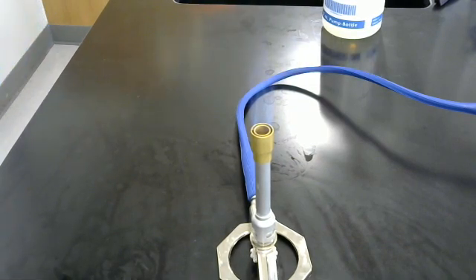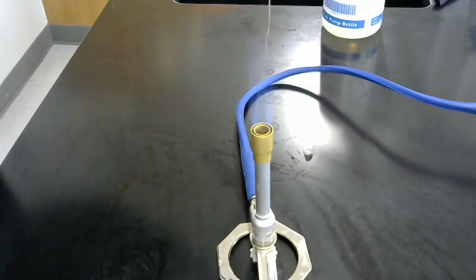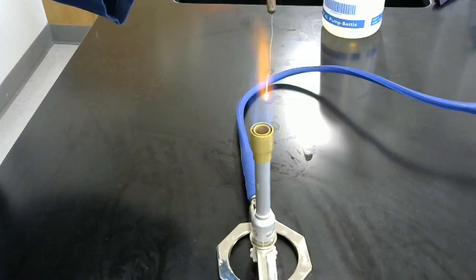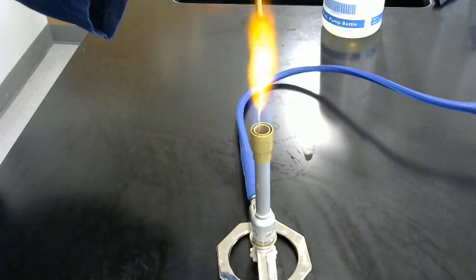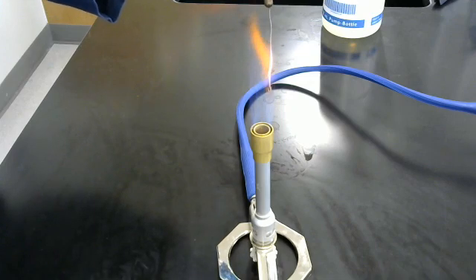And we're going to use metal tools this time. So you can see it, I am doing this with my left hand, but normally you would do it with your right hand. And we are going to do aseptic technique with our loop, get it nice and hot. Making sure that, yes indeed, we are doing this aseptically.